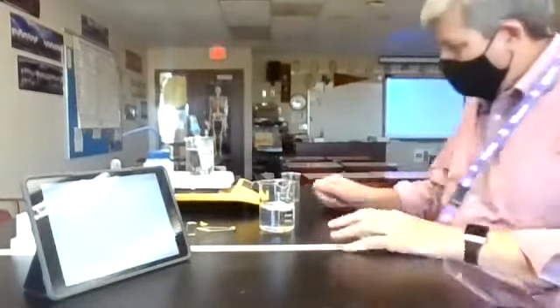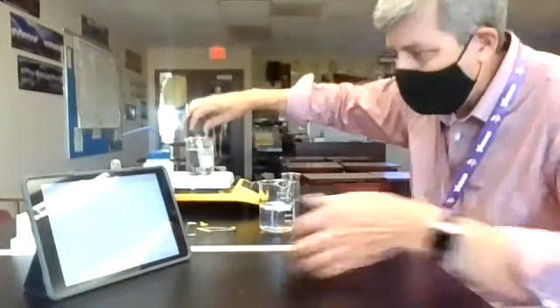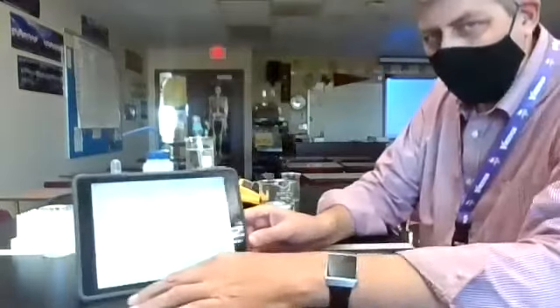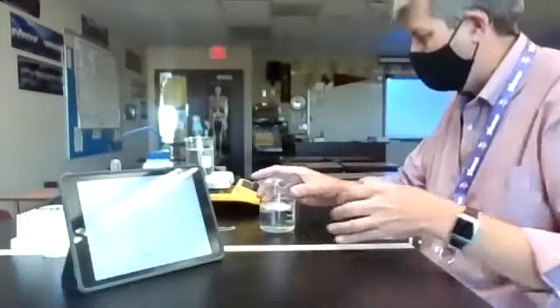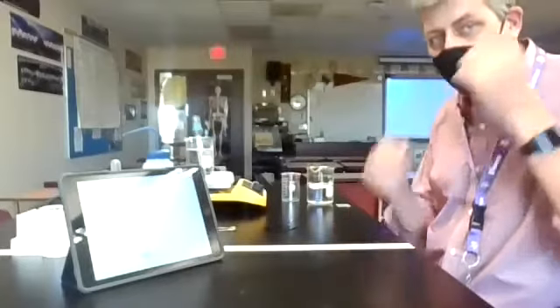And we're almost there. There's just a little bit of solid left in the bottom there. You can see we really have a pretty nice plateau there. Earlier in the graph, it was a little bit different, so that's good. That's working pretty well for us. I'm going to let it go for another couple minutes. It seems to be working nicely. It's fun when the lab works well for us.